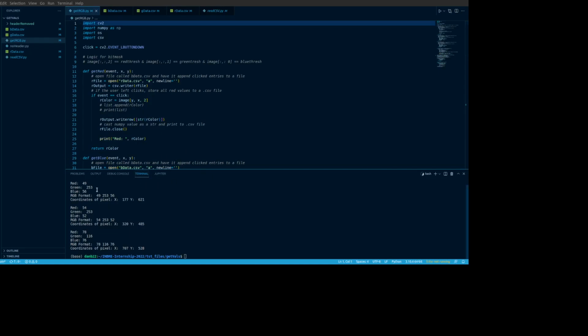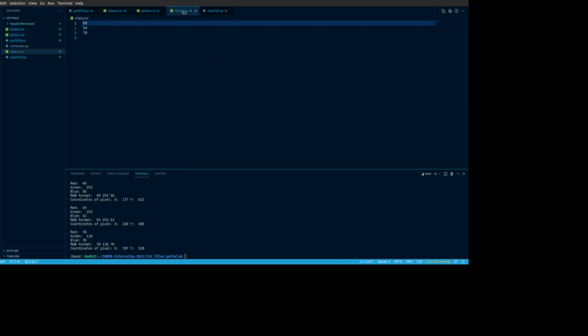So, that having been said, as we pull back out, it's important to keep in mind that we have CSV files here that are now blank, and we're going to go ahead and click about 2 to 3 times here and generate some data. So we'll go here, click here. Let's grab this one, and maybe, oh, there's a darker one over here, so let's see what that is. Okay, so now we're going to hit escape to close this window. We're going to go back to VS Code, there it is, and we're going to see that it ended up generating some coordinates for us, the tuples of what just got recorded, and of the red, green, and blue channels, of course. And we're going to also see that we have the data outputted to these CSV files.